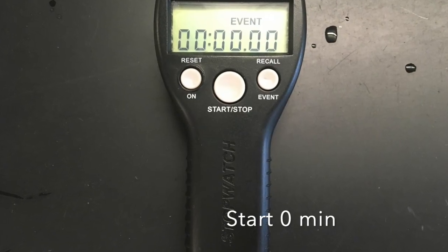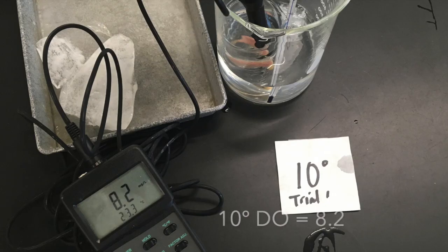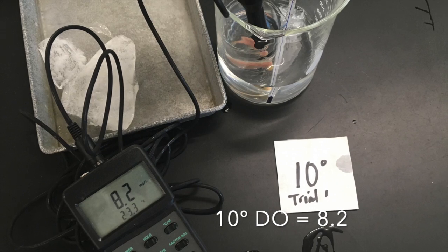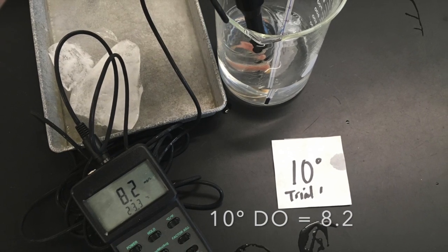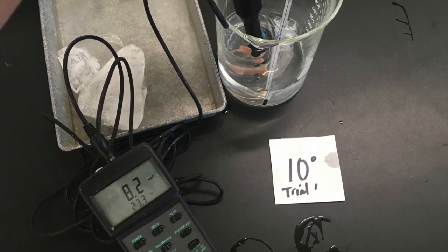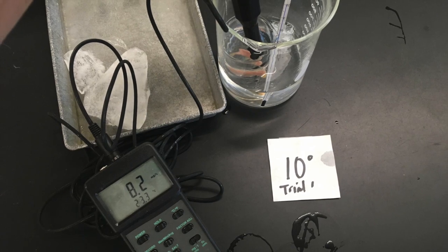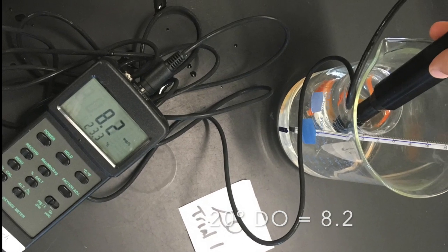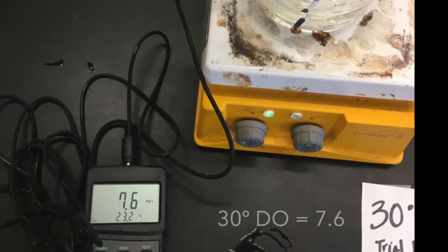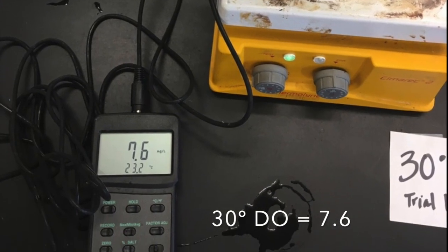We start at zero minutes. Our initial dissolved oxygen for 10 degrees Celsius is 8.2 milligrams per liter. It's the same at 20 degrees, and a bit less at the 30 degree Celsius starting time.